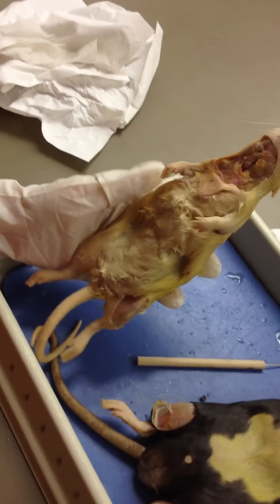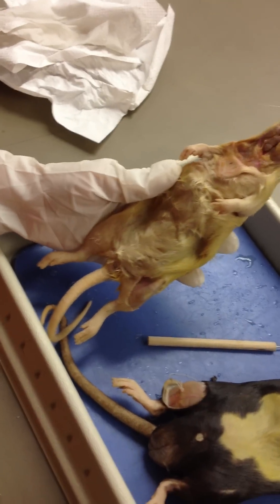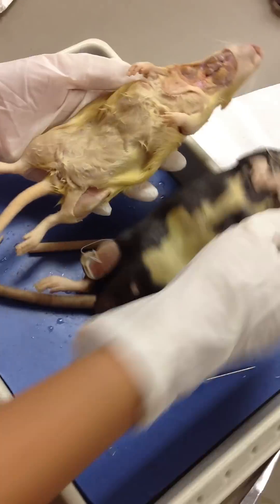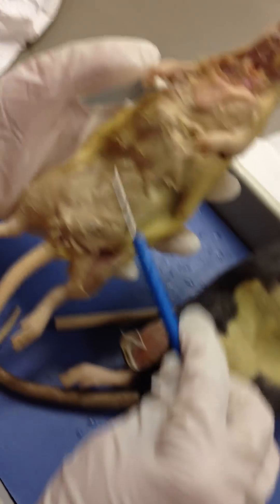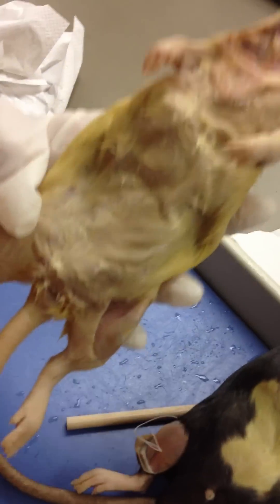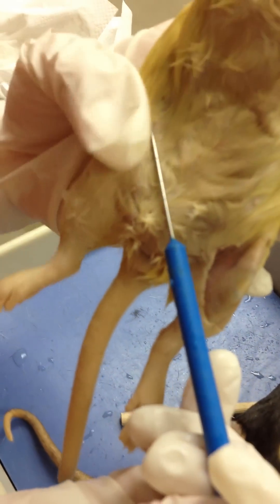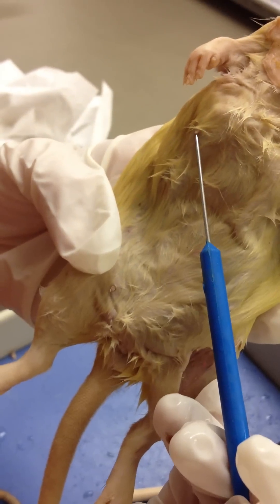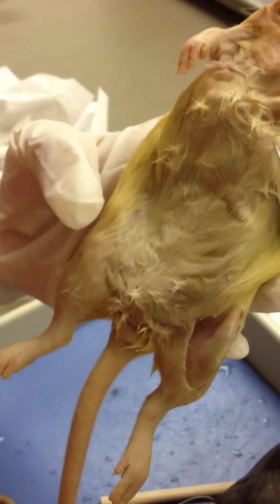Here are the external features of the rat. This is our female, and this is our male, as you can see. All of this is hair, and on the female, you see these mammary glands underneath the fur. Professor Huntley said there should be six and six.